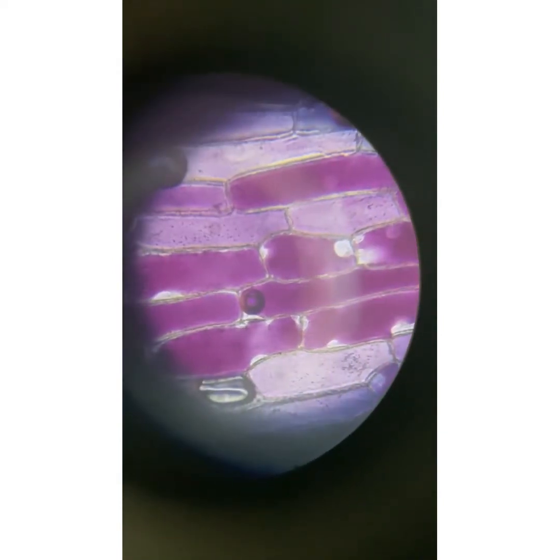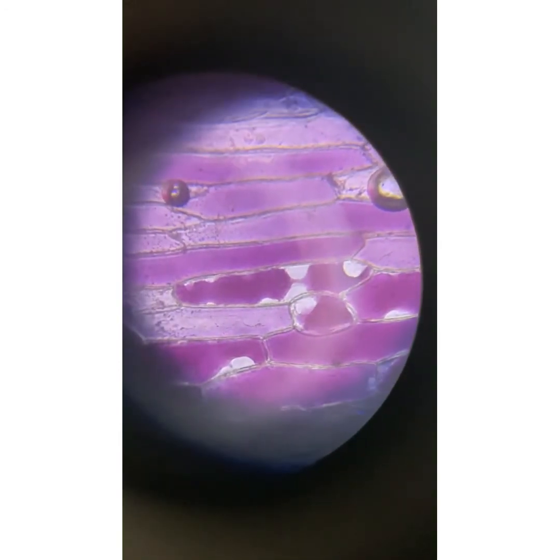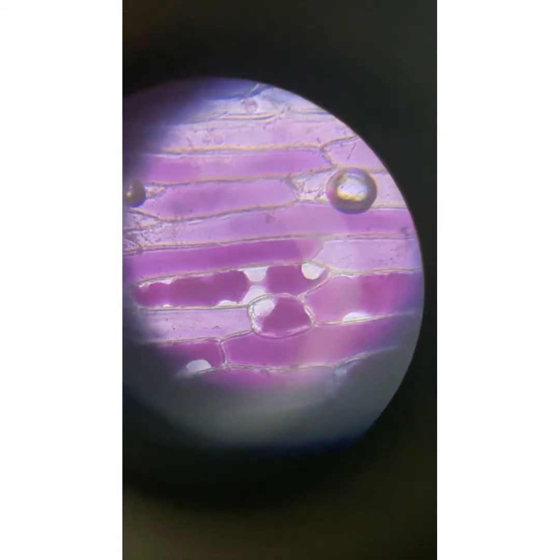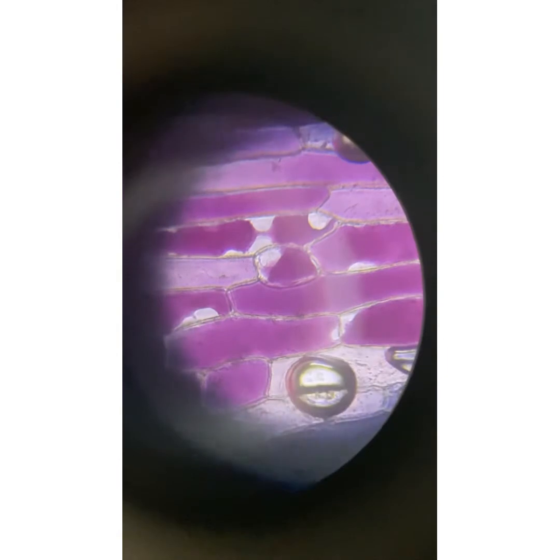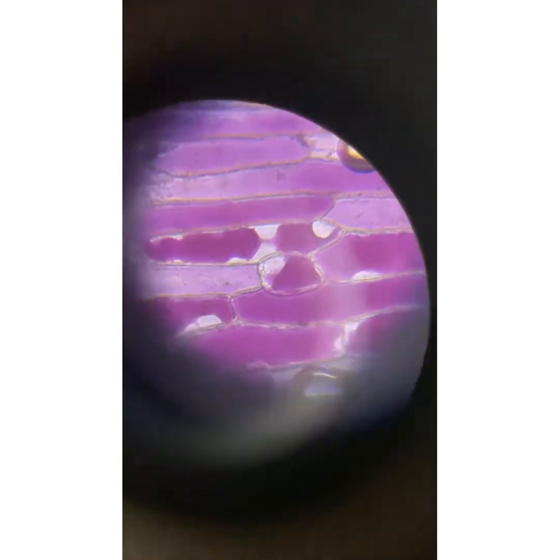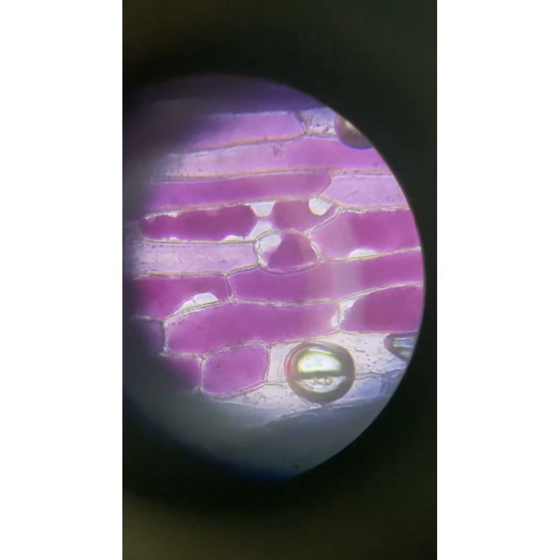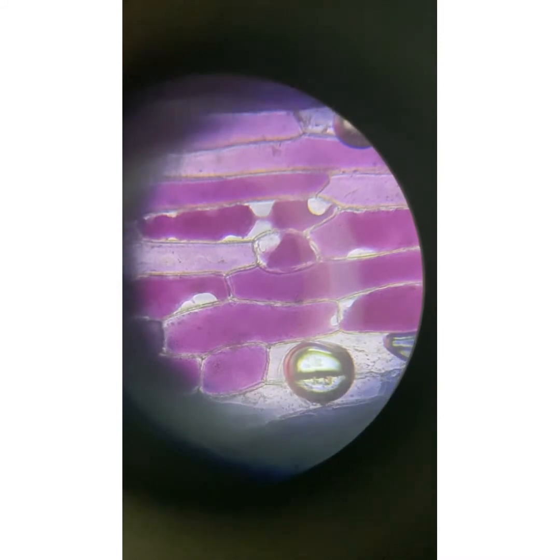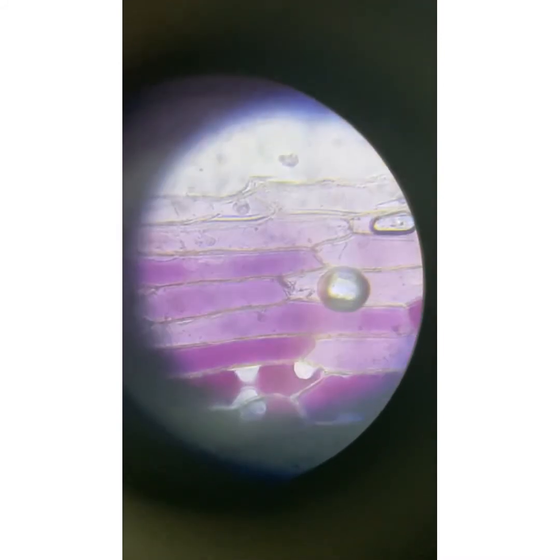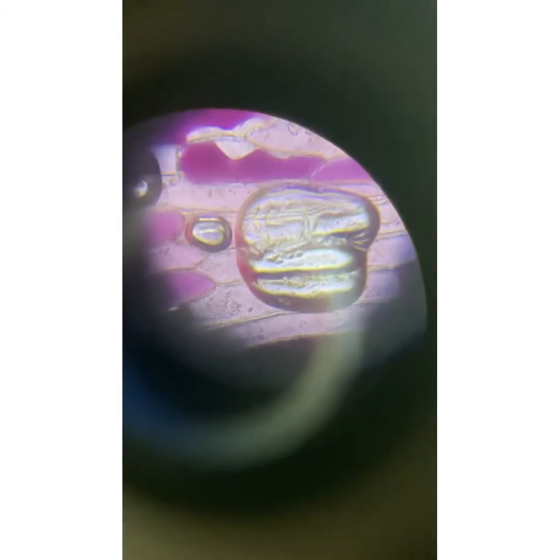A hypertonic solution has a higher concentration of solutes outside as compared to the inside of the cell. When plant cells are placed in a hypertonic solution, water is going to move out of the cell towards the region where there is a high concentration of solutes. Hence, this is why we are seeing plasmolysis occurring here in the onion cells.